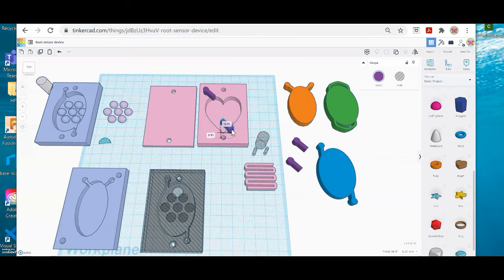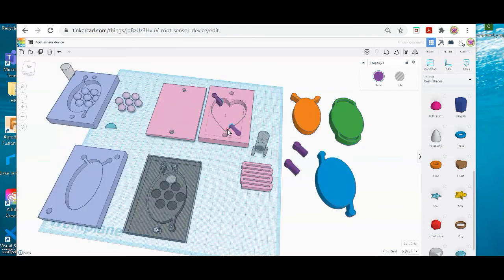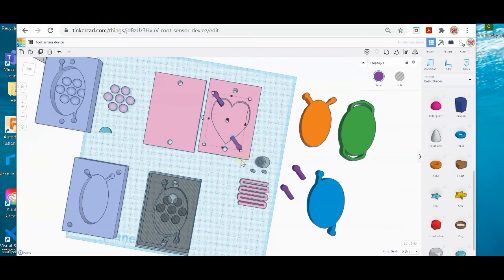Okay, so I rotated that one. I'm going to move it over here. And as you can see, I'm constantly changing my view. This really helps me align things. So you should never be kind of stuck in one plane. You need to be moving around a lot. Okay, so let's say I have this aligned where I want it. I am going to make it a hole, and I'm going to do the same thing I did with the heart. I'm going to draw a selection box and select all these here, and then I'll group it.